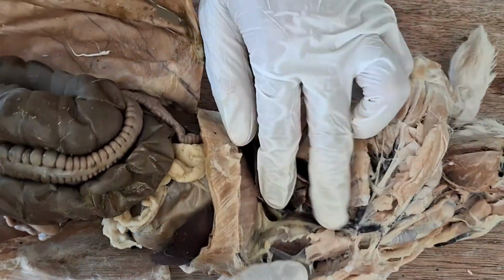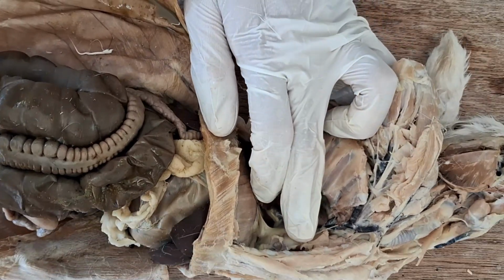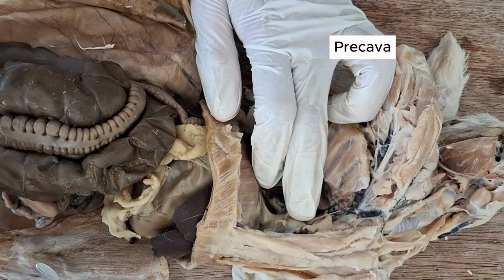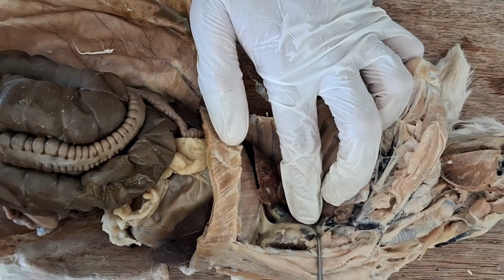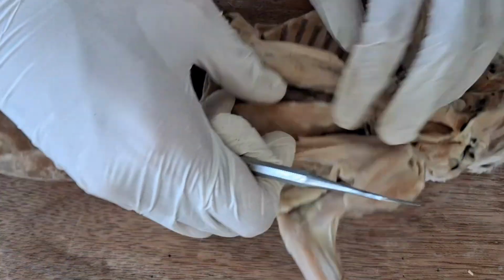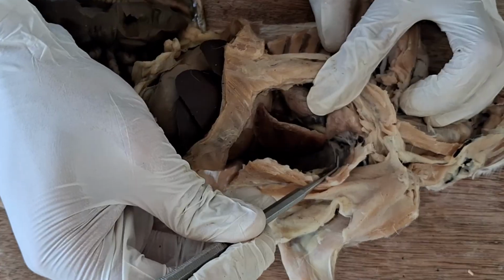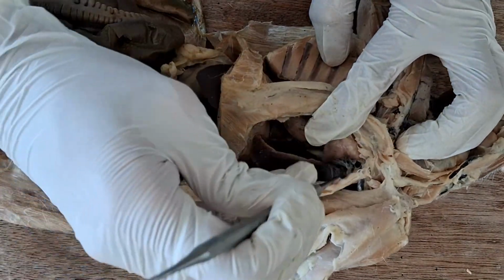So in the rabbit, there are two precaval veins or superior vena cava. So this is the right precaval vein draining directly into the right auricle or atrium of the heart. Of course, there's a left one, but I haven't dissected it completely. It's symmetric anyways, or almost symmetric.